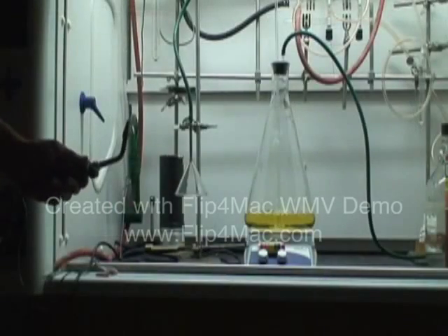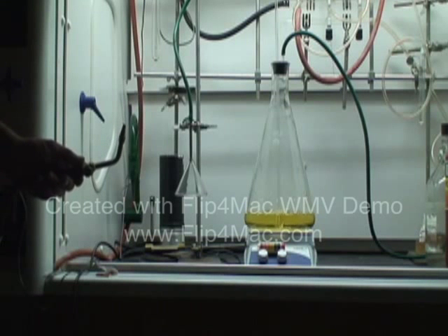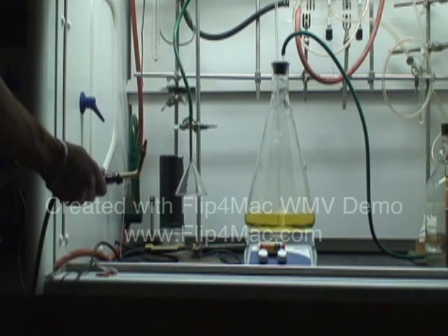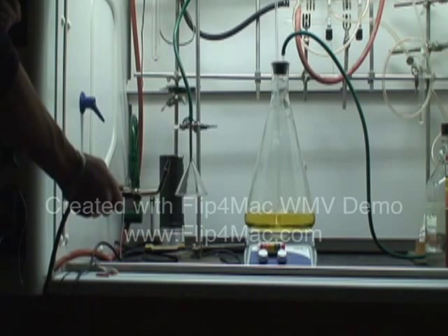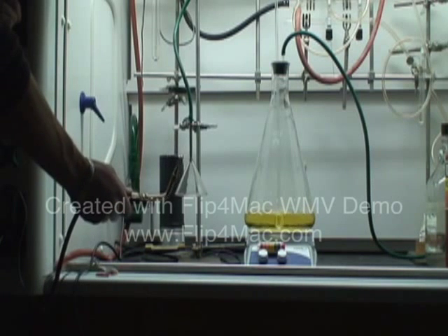Our first example is going to be the combustion of hydrogen. This torch is actually lit, and we are going to turn off the lights in the hood so that you can actually see the flame, because hydrogen flame is nearly invisible.